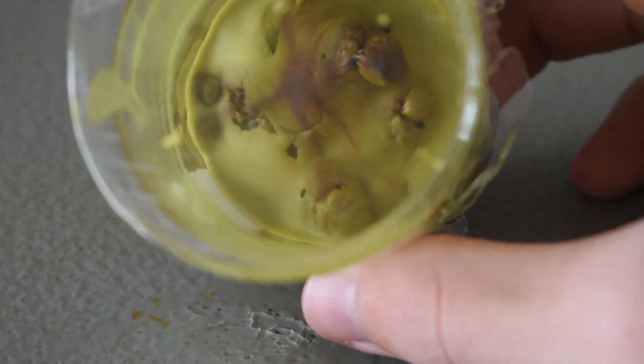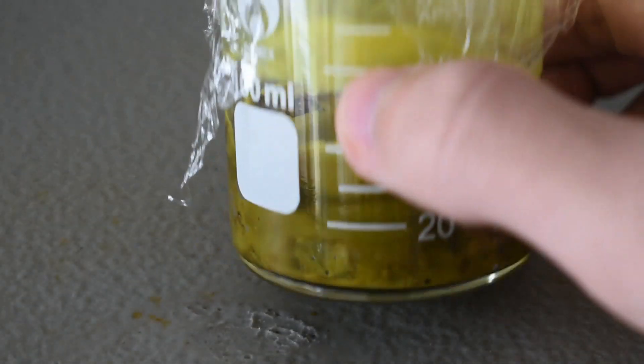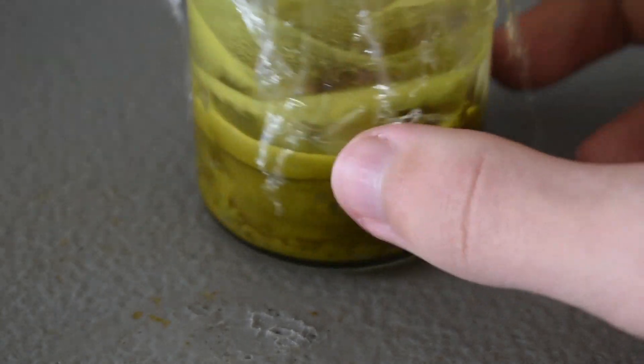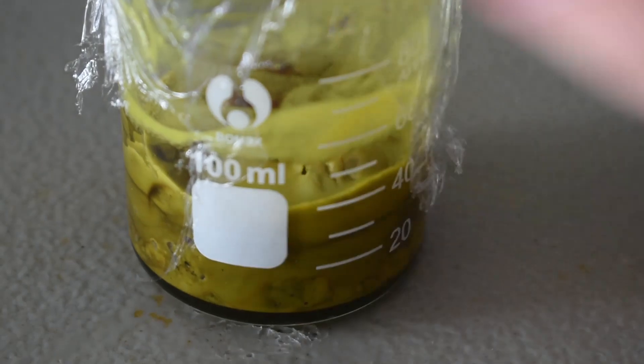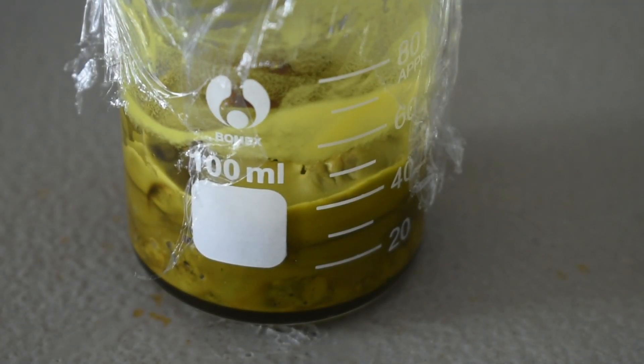And that brown stuff on top is just oxidation. So hopefully the methanol will be able to facilitate the separation between my product and any unwanted oxidized byproducts. So I'm going to get some methanol and I'll pour it in.